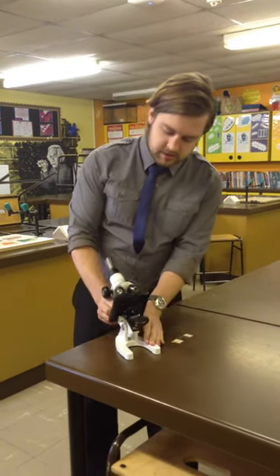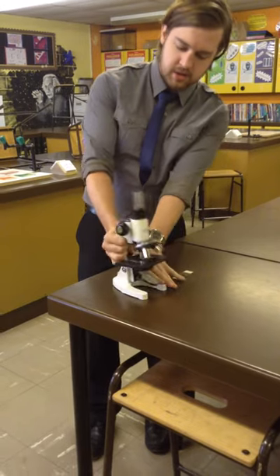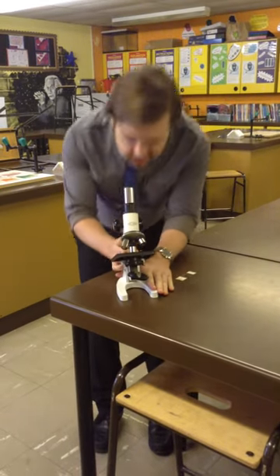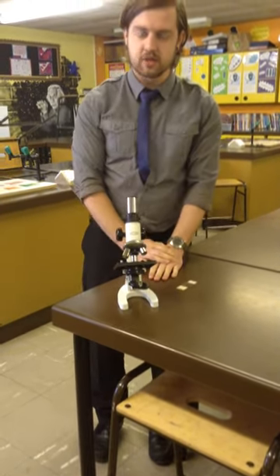So the first thing you need to do is make sure to hold the base, use the arm to make sure the microscope is at a nice point just for you to be able to look down through it.